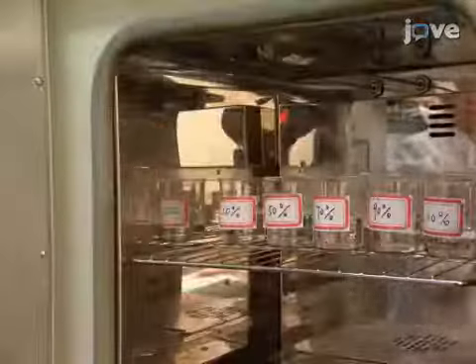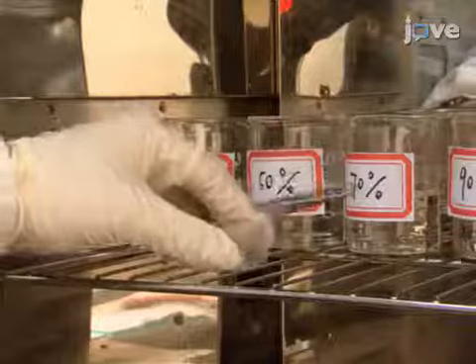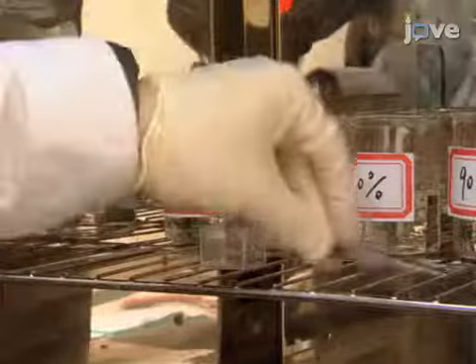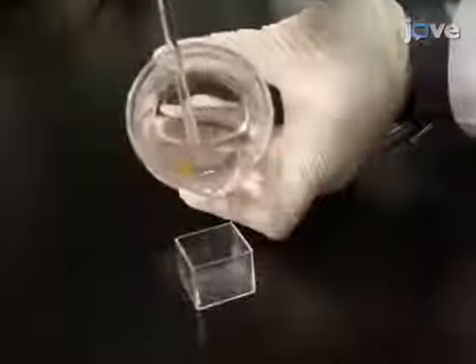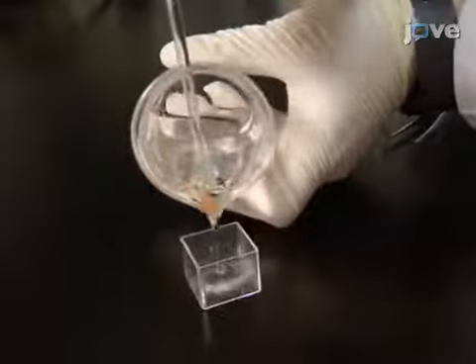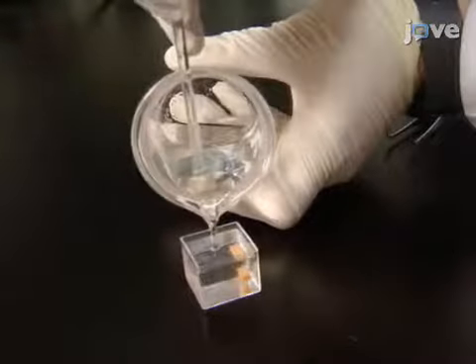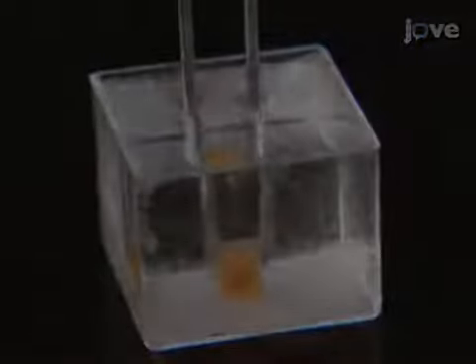Next, pre-warm a cassette at 65 degrees Celsius in an oven. Pour the tissue block containing PEG into the cassette, and then place the tissue block in a desired position using pre-warmed tweezers.